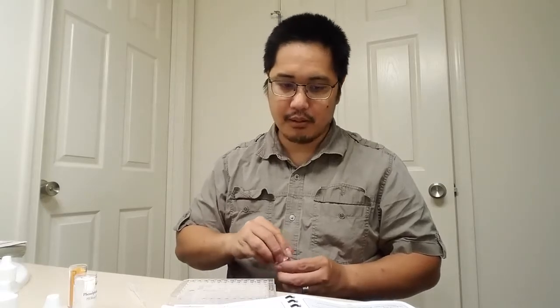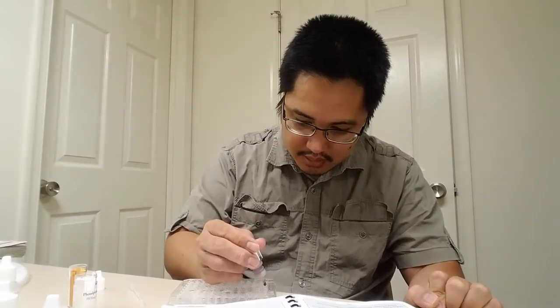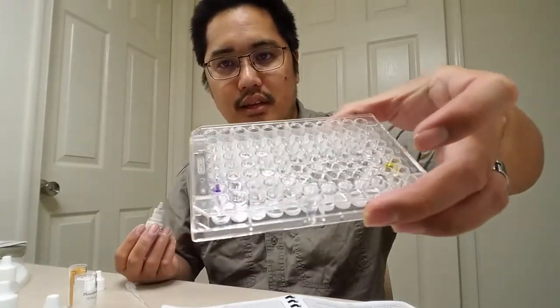Interesting. All right. And the last one is bromothymol blue. This guy right here. I'm going to put 1 drop. Is it 1 drop? Of bromothymol blue. You know what? It doesn't tell you how many drops, so I'll let you decide how many drops to put. I'm just going to put 1 on each end and show you.